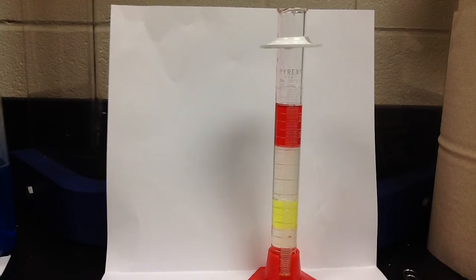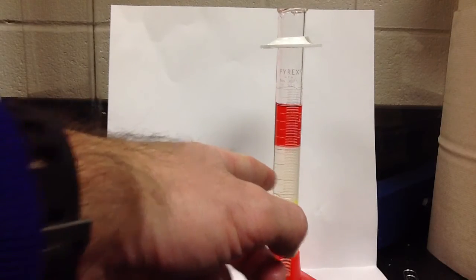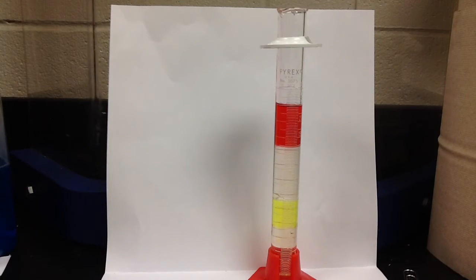Okay. I also kind of did that because I know that if I had poured it earlier, transmission fluid and vegetable oil here, they tend to mix together and dissolve in each other. So I sort of knew that, and so to make things a little bit easier to see, I poured that in last.